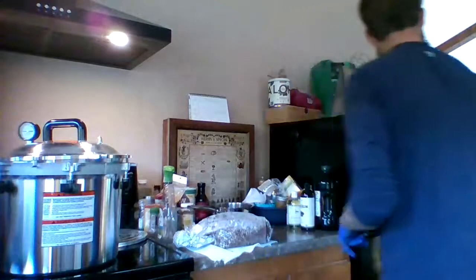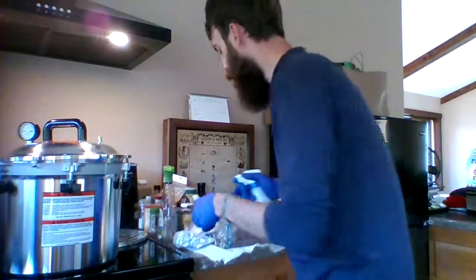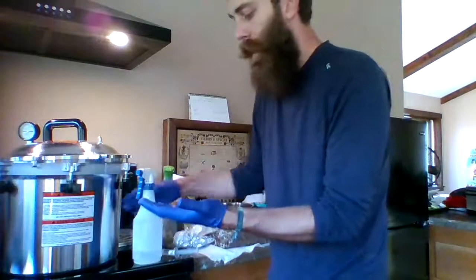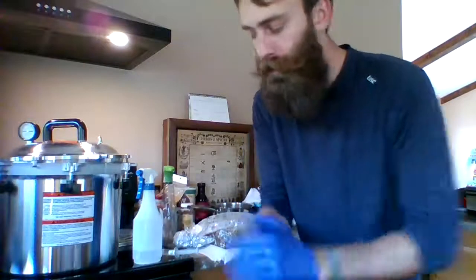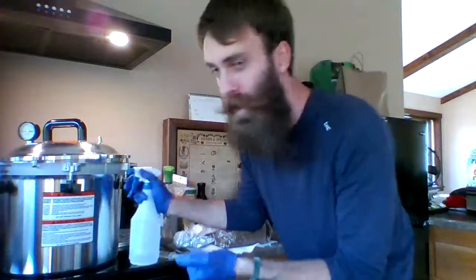What we're going to do is spray everything with isopropyl alcohol, and that's in this bottle. I didn't really clean it out, but it's pretty clean — it kind of smells like essential oils, but there's all alcohol in there. So now it's clean. I'm just going to get the sterilization going. It's a little weird that you have to use this many precautions, but I've seen multiple videos of this going on just like this.